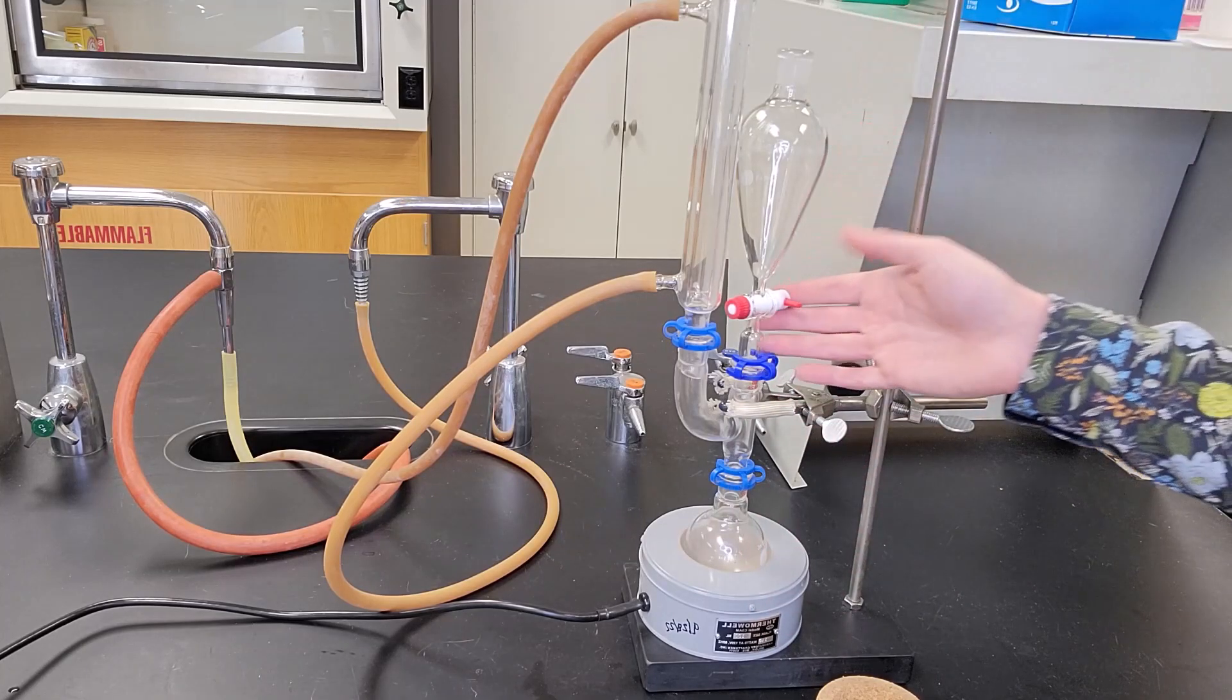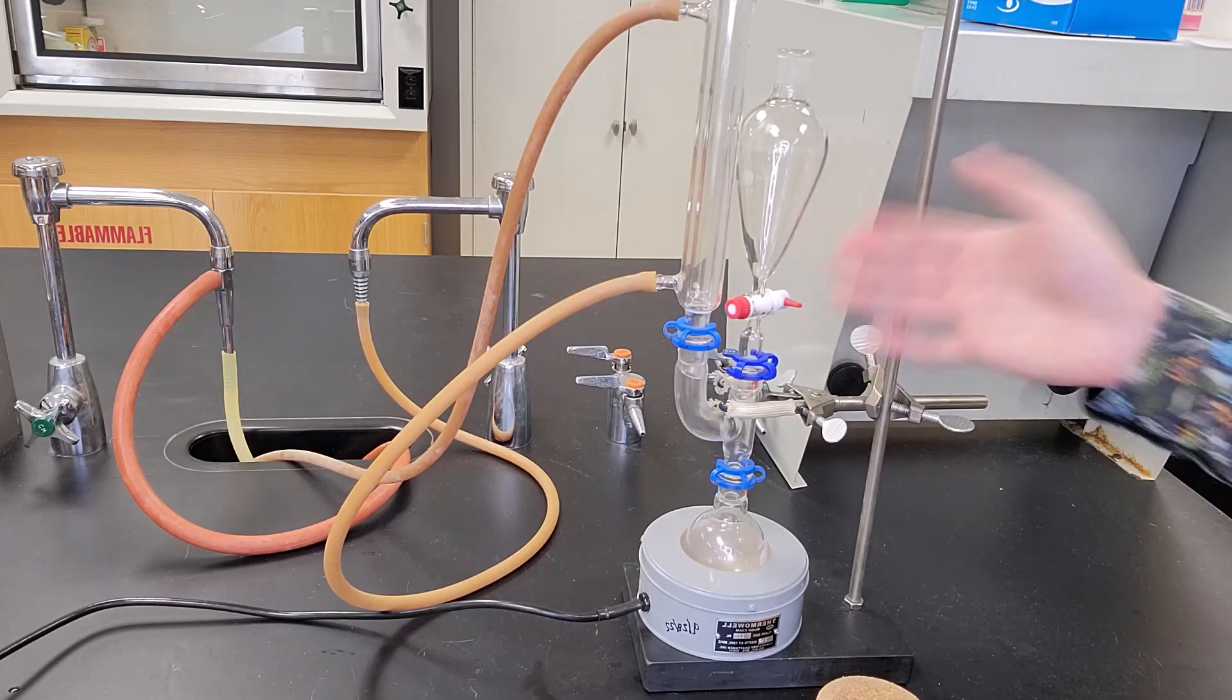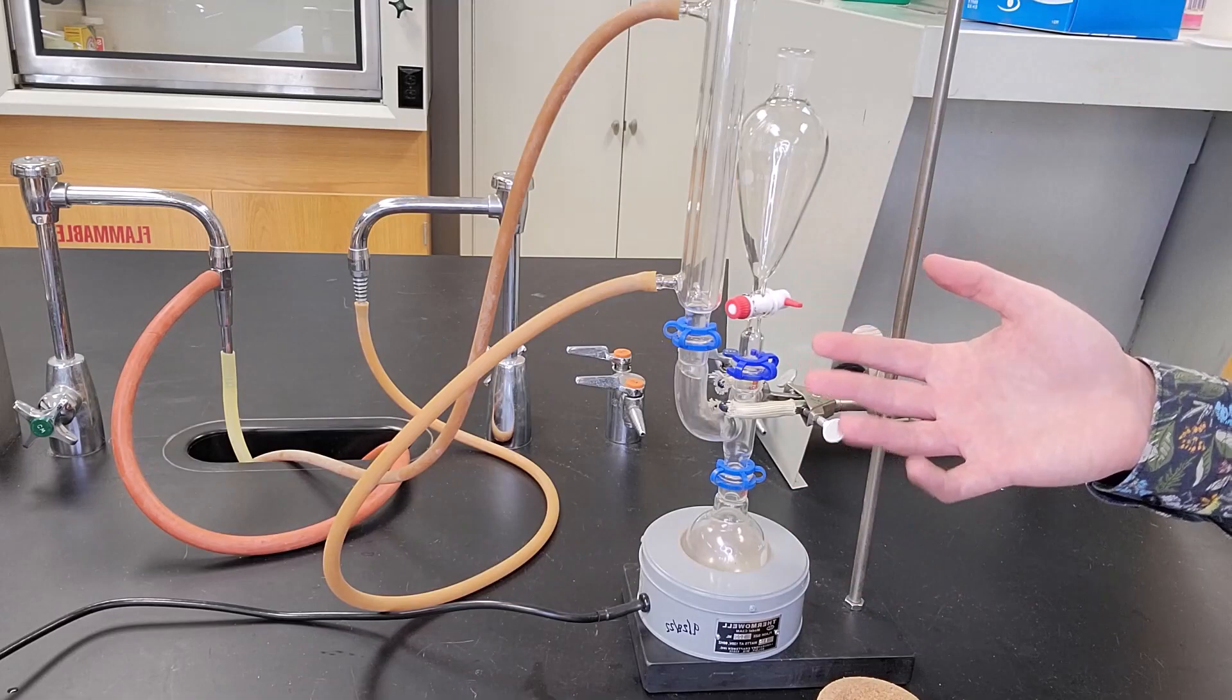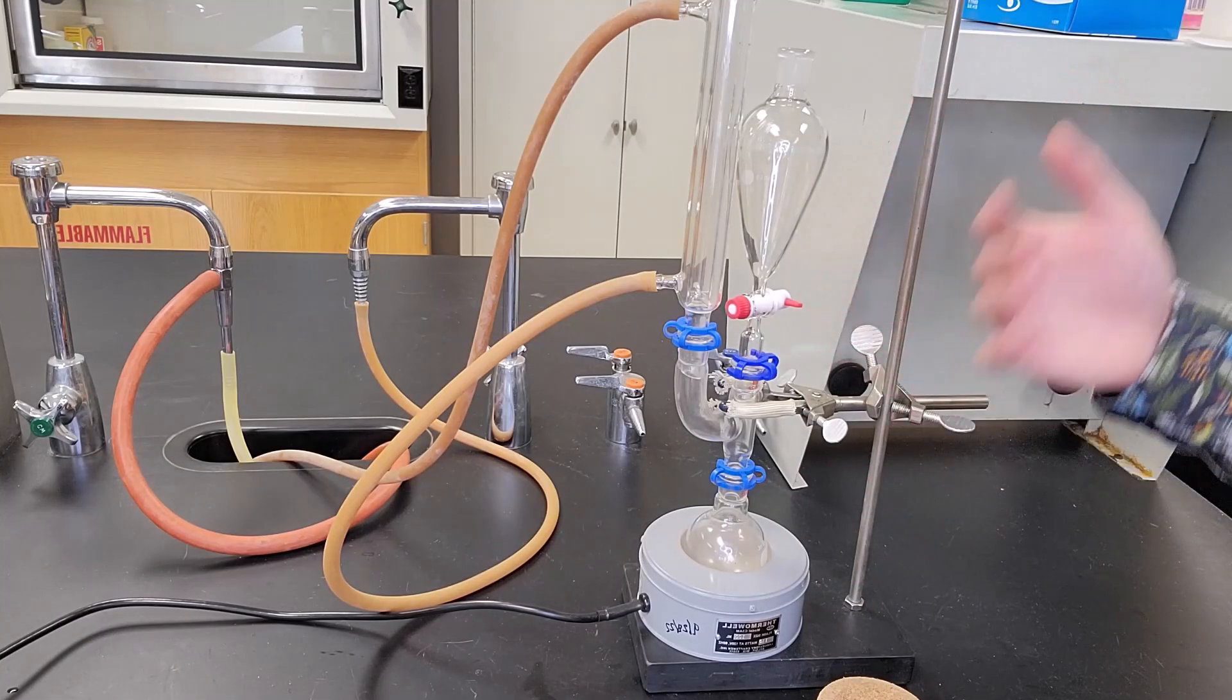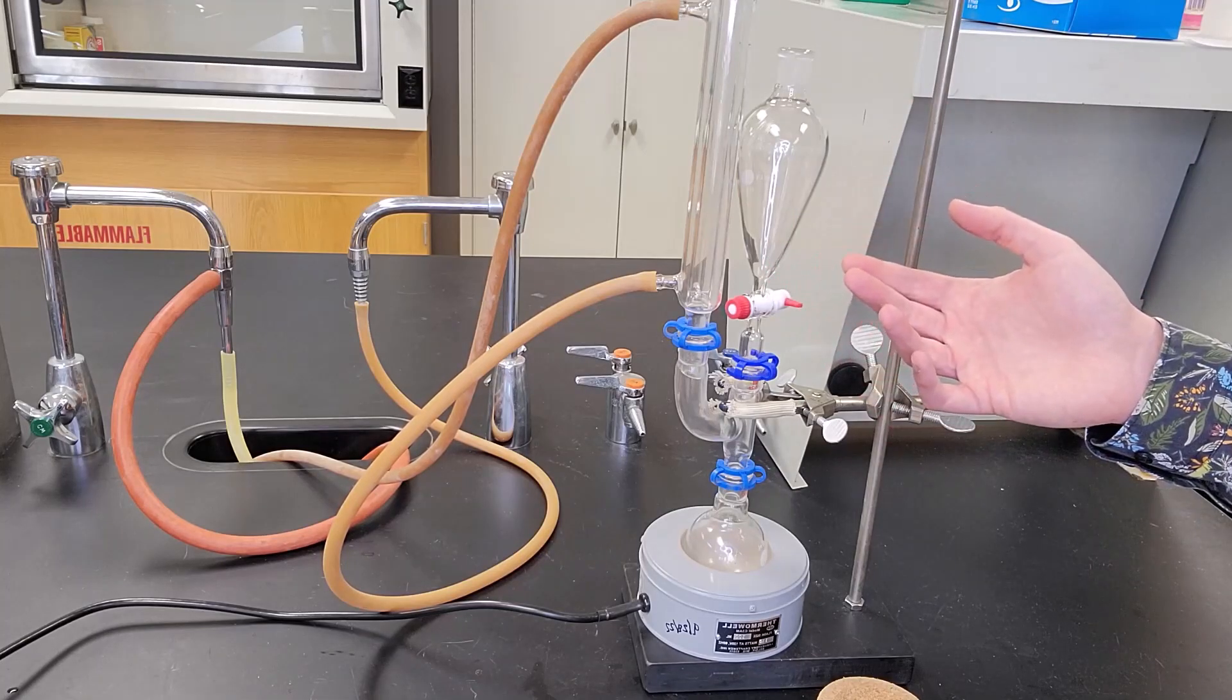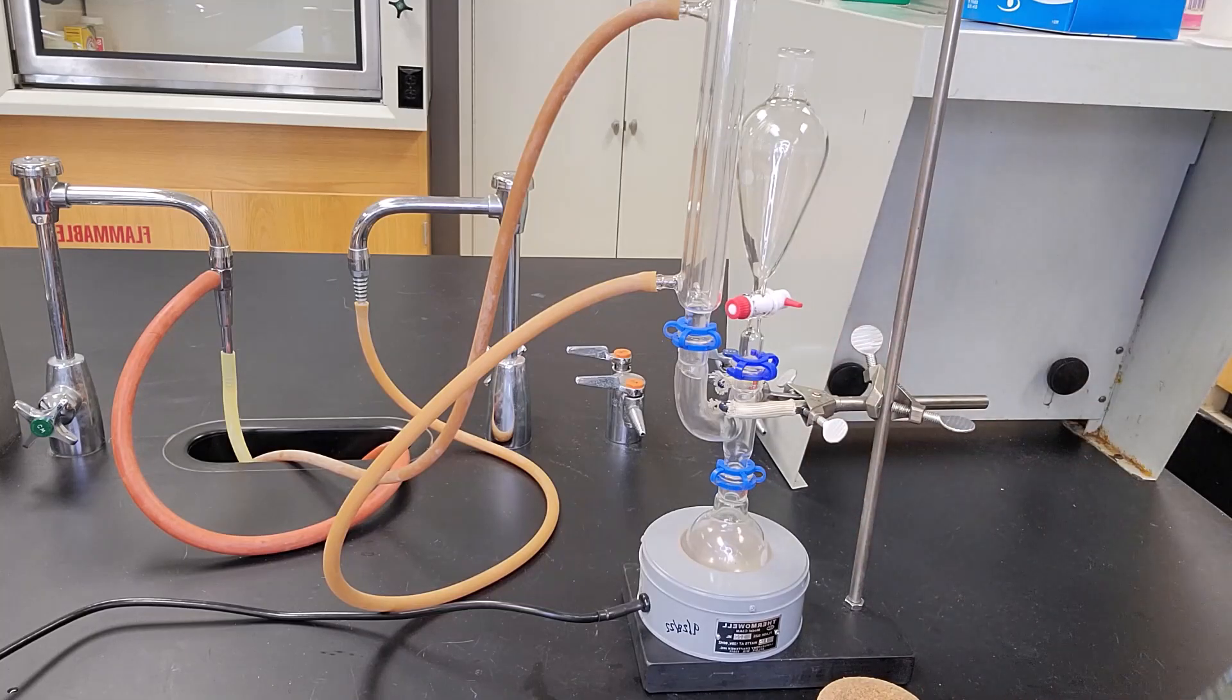Again, very useful if we want slow controlled addition of a solution or a liquid or a solvent to our reaction mixture. And you'll see in second semester 252 that we do use this again to add various reagents. So this is a very useful technique and a useful piece of glassware to do controlled addition to a reaction mixture. Thank you.